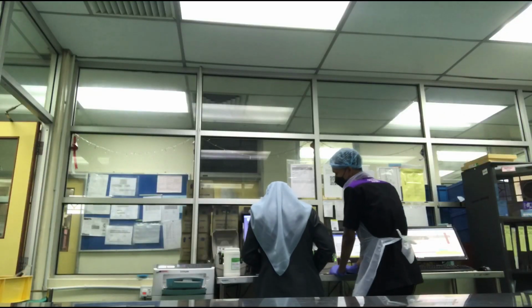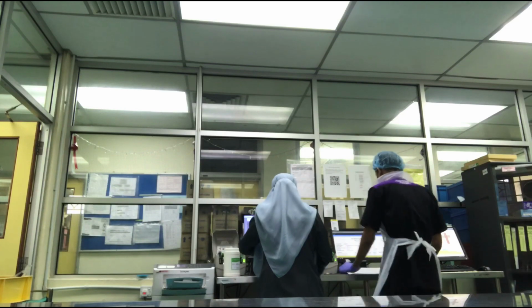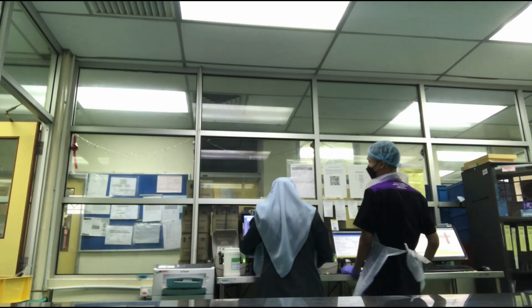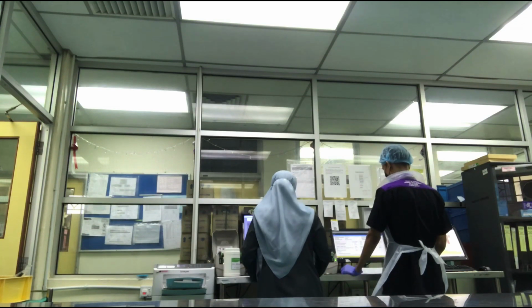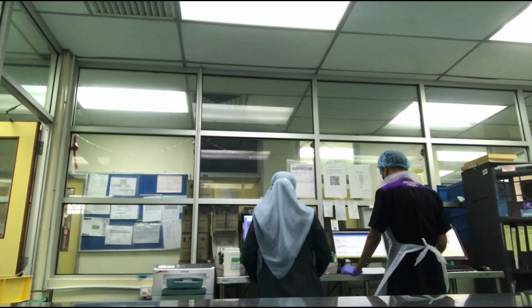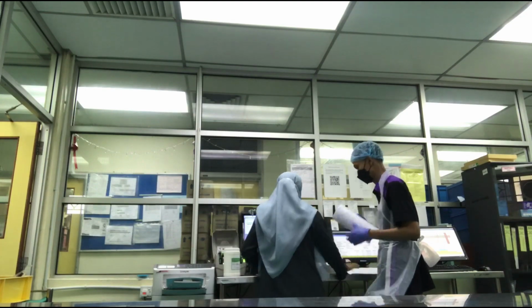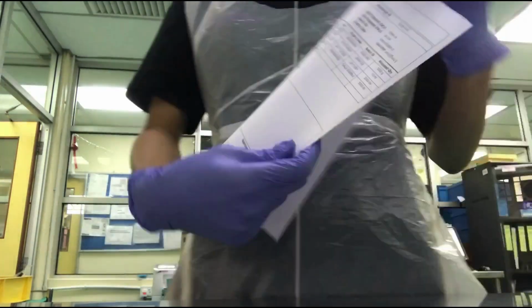Before preparing anything, it is crucial for us to create a worksheet, which is a galenical worksheet. The galenical worksheet contains all sorts of important info such as product batch number, expiry date for raw materials, method of preparation, and also who prepared the product. The galenical worksheet makes the counter-check of the final product easier for pharmacists.